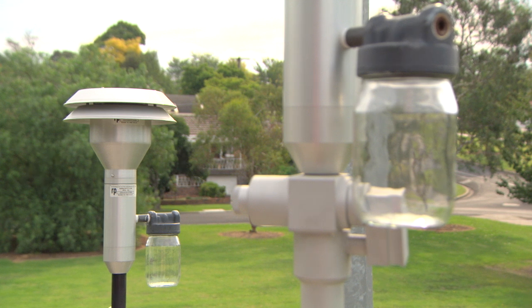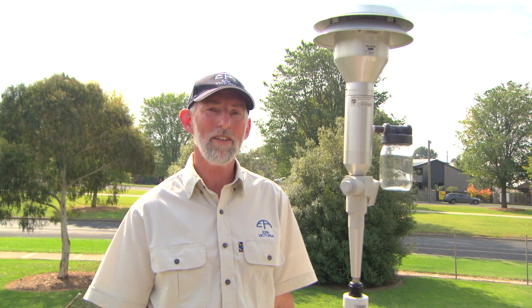This inlet draws in air to measure particulate matter 2.5, or PM2.5. The concentration of PM2.5 is one of the more important indicators of healthy air. PM2.5 particles are extremely small particles present in smoke and in some fine dusts.